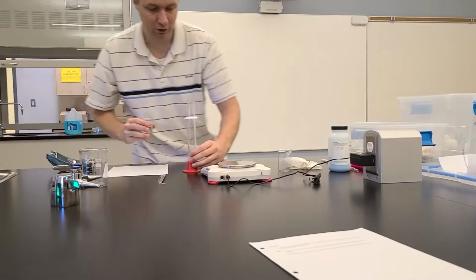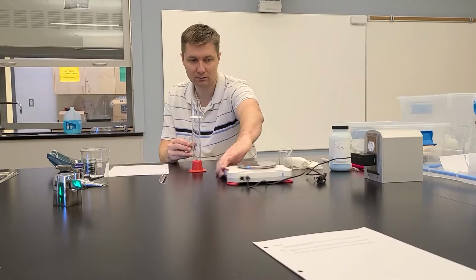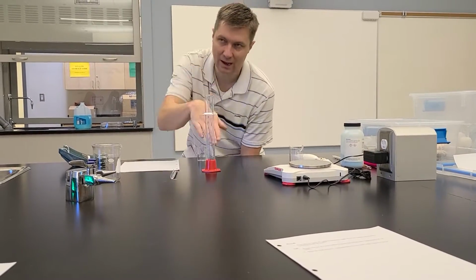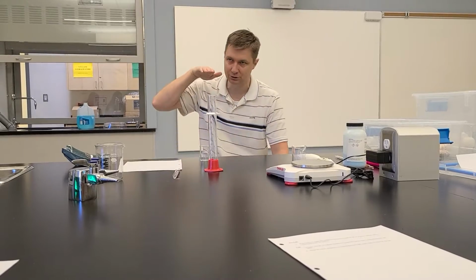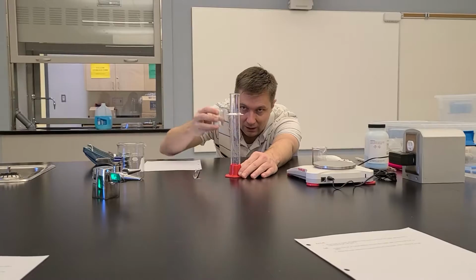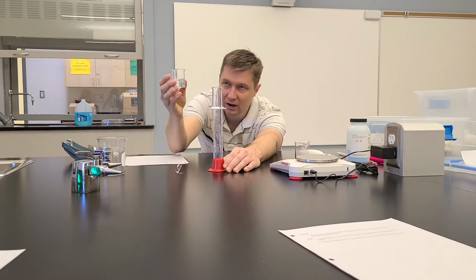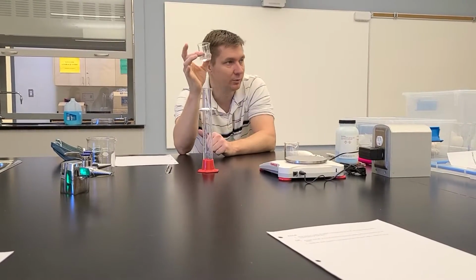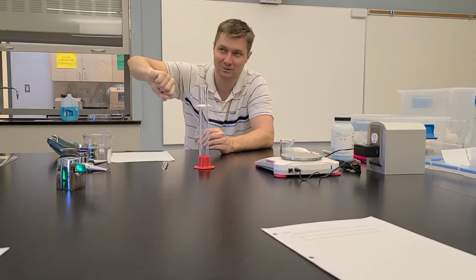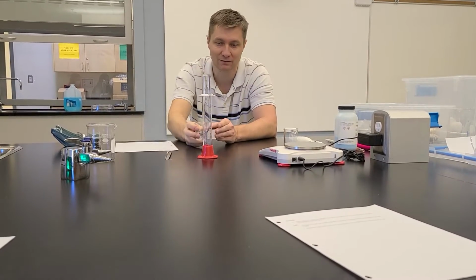And then what you wanna do is at eye level, you wanna not read these numbers looking down. Whenever you're reading numbers in chemistry, you gotta look at it straight on, okay? So you get down low to where the 20 line is, and then just ever so slightly pour this in. Now this is the best way to have control with this. If you do it in the sink, as oftentimes it happens, we turn it on and then you get way more in there and then it splashes everywhere and stuff like that.